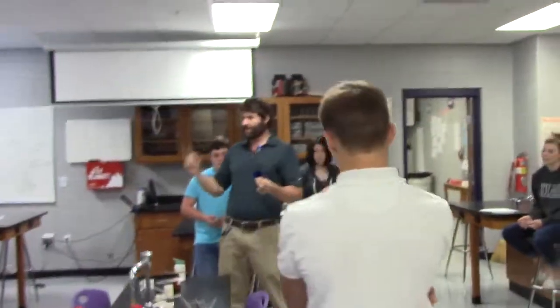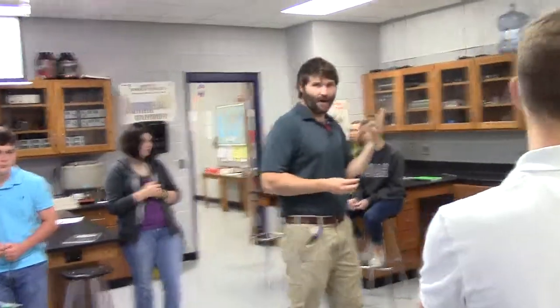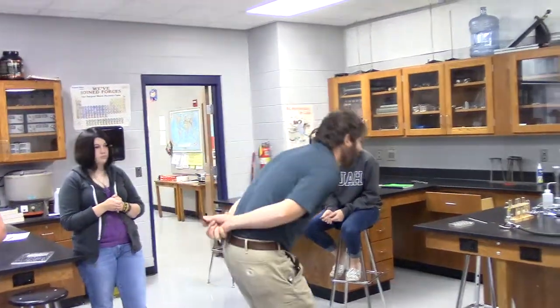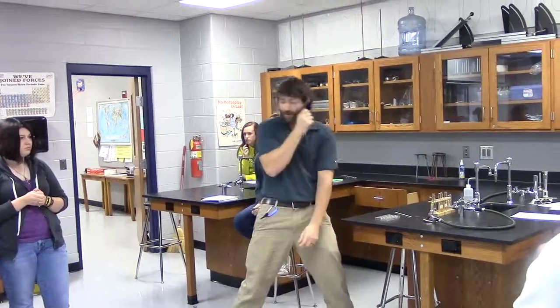So if you notice on the data table, you're supposed to do sodium twice and potassium twice. Did you see that when you were writing it down? You're supposed to do sodium once with your bare eye. Then you're supposed to do sodium a second time with a piece of this cobalt blue glass. So in other words, you watch it burn through the glass.